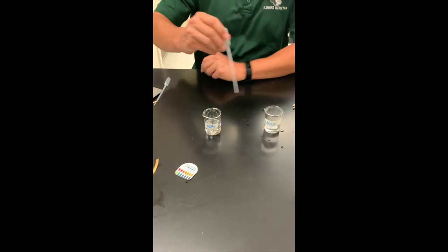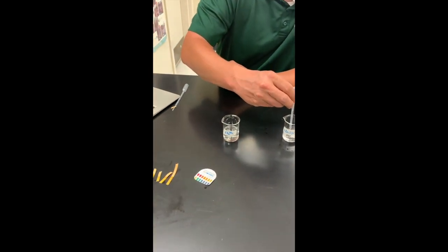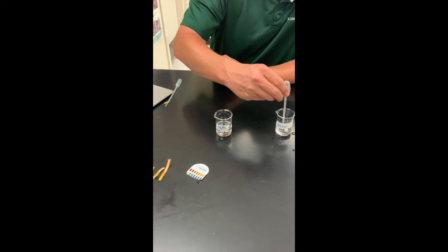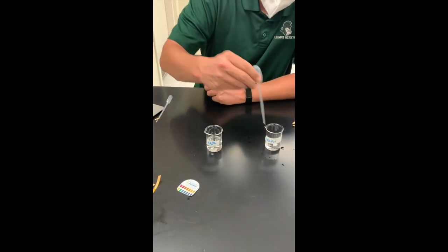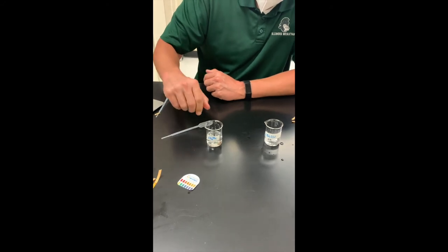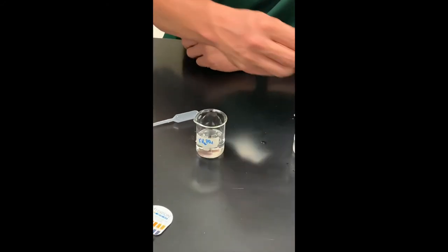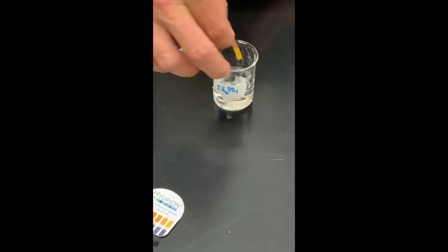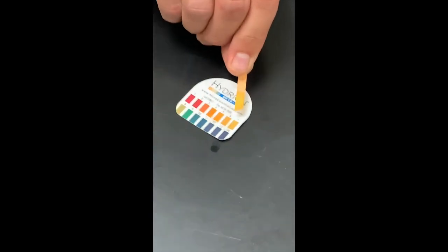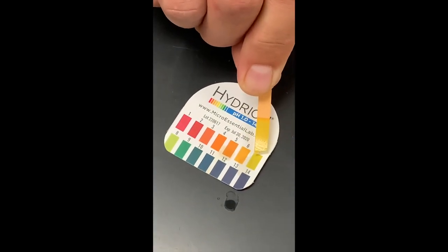After four milliliters, here is our fifth and final milliliter of sodium hydroxide added to our potassium dihydrogen phosphate. That's still sitting at a seven.